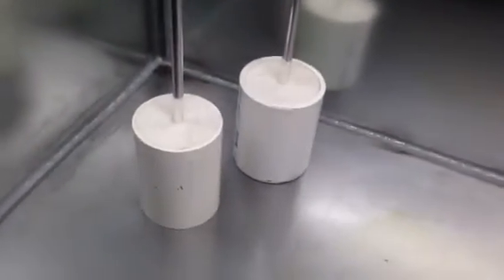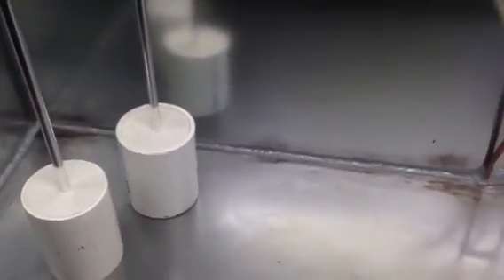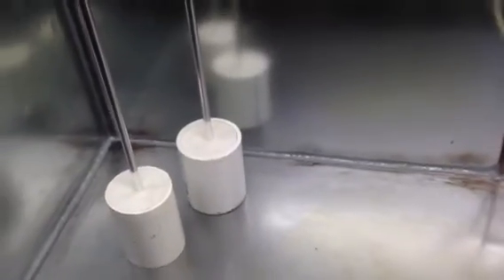My lab stands here — it's just a piece of steel rod with one end flattened so that it can't pull out of the plaster that's down there. The plaster is poured in a piece of 4-inch PVC vent pipe.